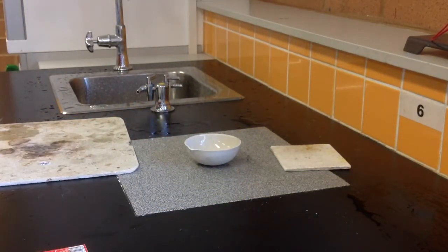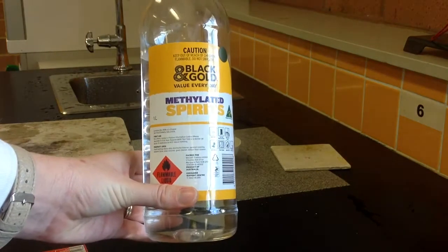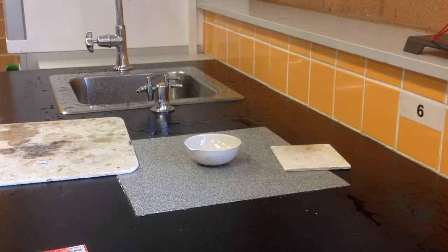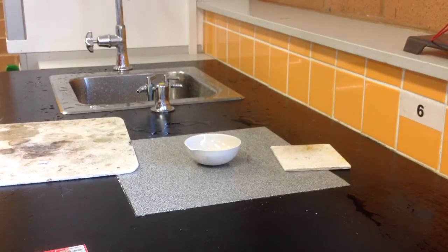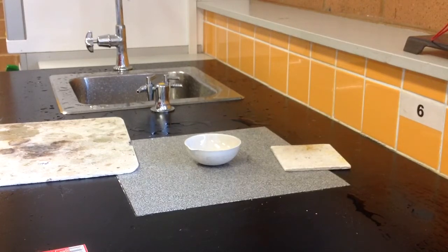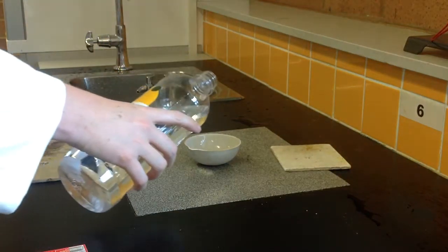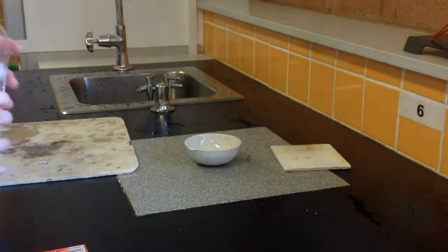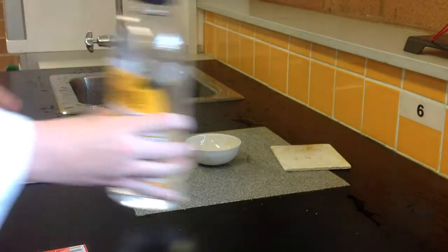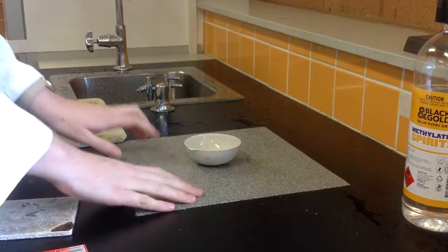What we're going to look at firstly is methylated spirits and what happens if we ignite it. Part of this is actually important for you to realise, so that if you ever come across a fire from a liquid chemical such as petrol or methylated spirits, you know what to do and what not to do. One thing you don't do is put water on the fire, and the second thing you don't do is blow it out. We did this in class with just a small evaporating basin and a small amount of methylated spirits — you don't need much. We had a small heat mat and a large heat mat and we did it on a heat mat on the bench.